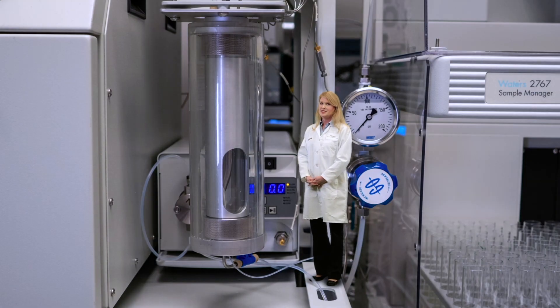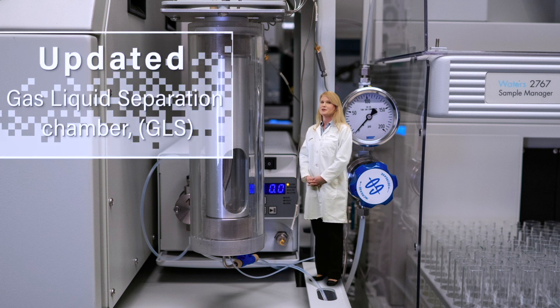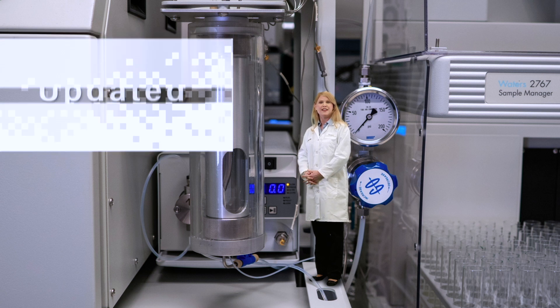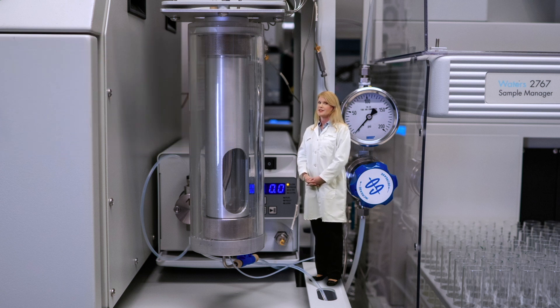After detection, the sample moves through the updated gas-liquid separation chamber, also known as the GLS, to remove CO2 from the co-solvent.